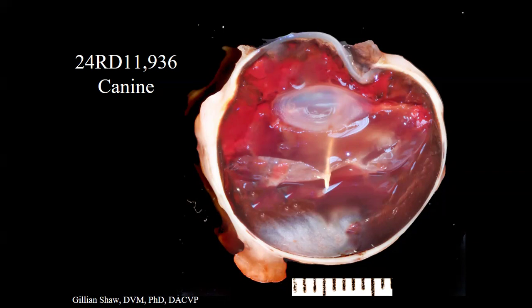When we hemisected the eye, the cornea is up at the top here. It's a little bit cloudy, so there's probably some corneal edema. The anterior chamber is not visible in this, so we have anterior chamber collapse. There is hemorrhage in what is now the posterior chamber, the vitreal space, and a little bit in the subretinal space. Here's the detached retina. Here's the lens, and what we have is this very obvious off-white linear foreign body that is in the eye. So this was lodged somewhere up here in the eye, closer to the ciliary body or anterior segment.